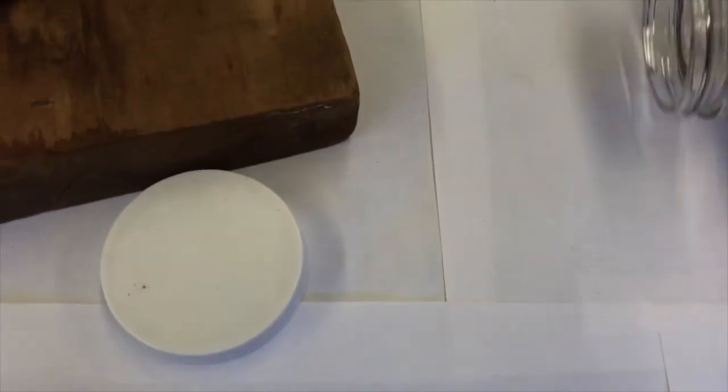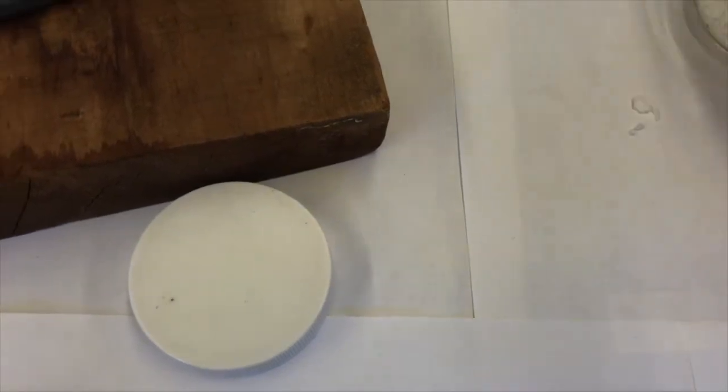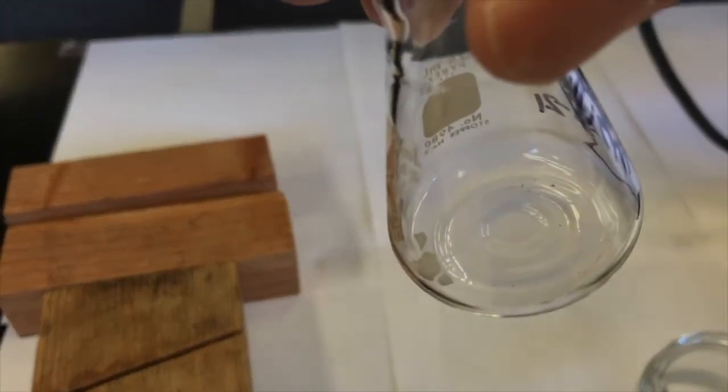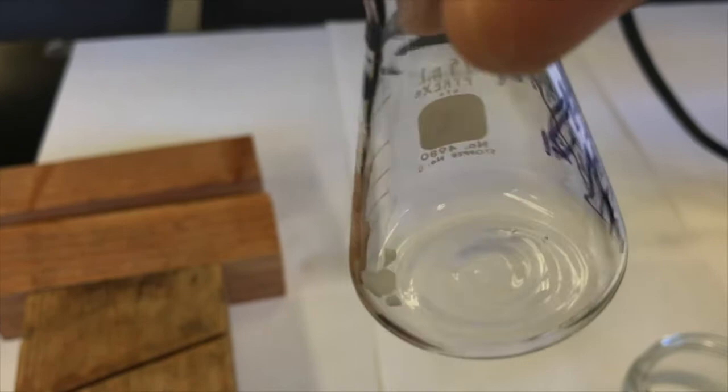So I'm going to put a couple of those inside of my crystallization solvent flask. So let me get a couple out. There we go. Not too many because it's just going to be a pretty small amount of solvent I'm using here. So there it is. I've got some Teflon boiling stones inside of my ethanol flask.